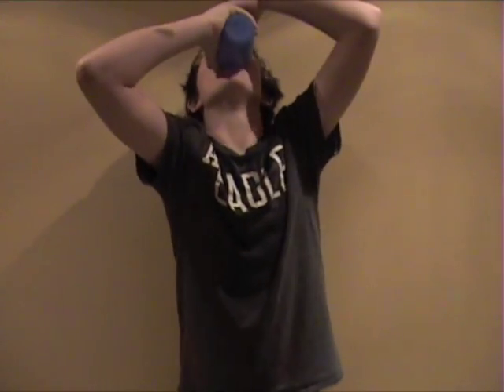Rule number two, never drink anything in the lab. Colton, are you okay?